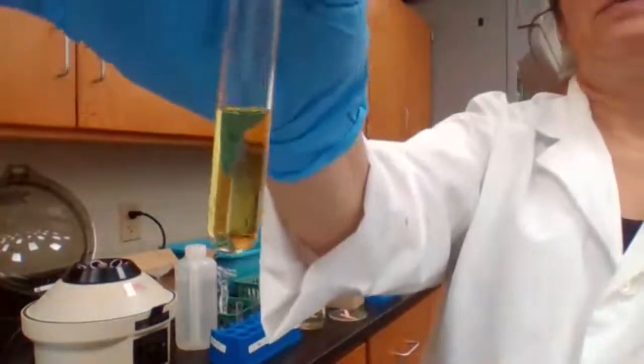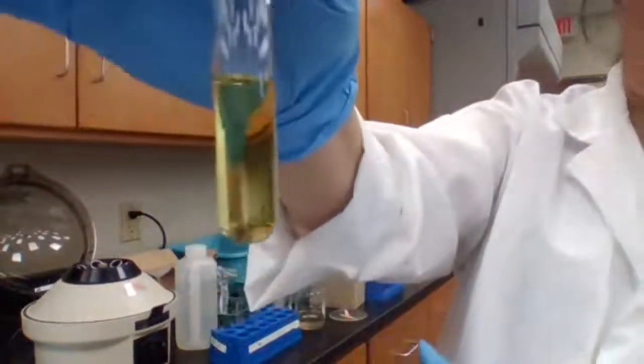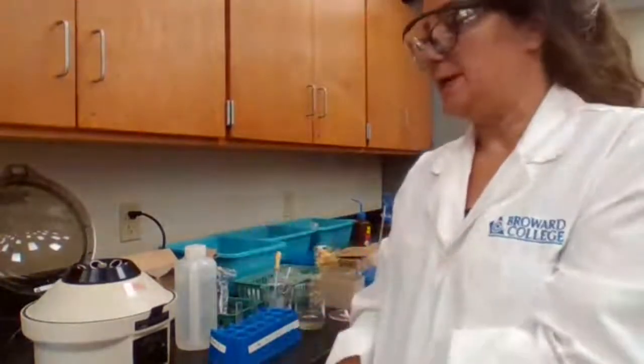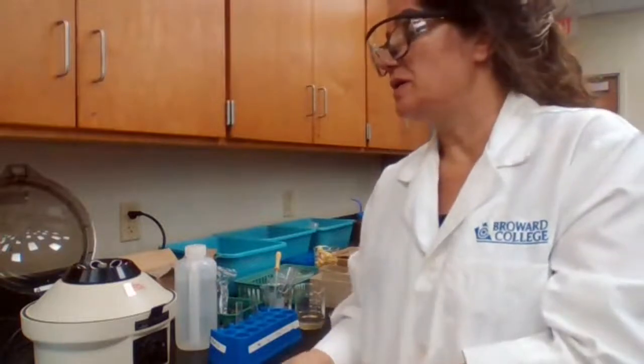I'm just going to help you with one thing here. I see color. I don't see precipitate here. And that was for 3J2.